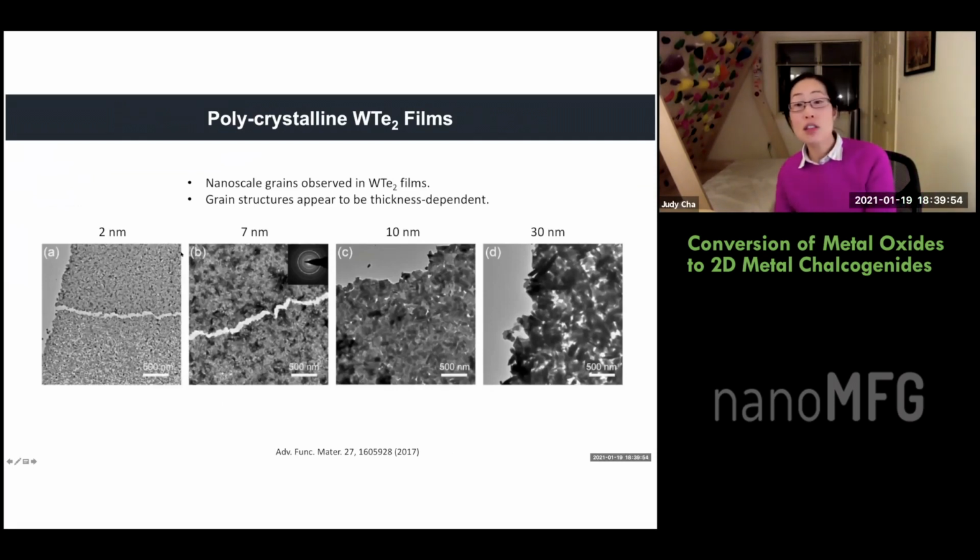So here is the tungsten telluride. These are the nominal sputtering thicknesses of the tungsten, initial starting points of 2 nanometers, 7, 10, and 30. But now this is after tellurization. So you can see that the grain sizes are at the nanoscale, 10, 20 nanometers, okay? So this is terrible for transport. If you want to do transport measurements, this is terrible. So why is that?